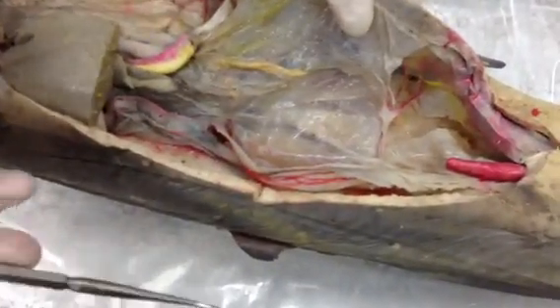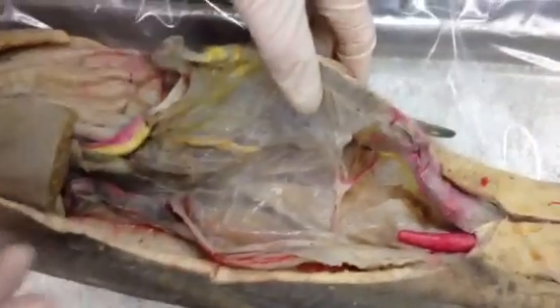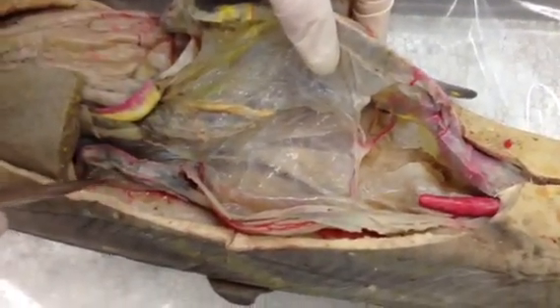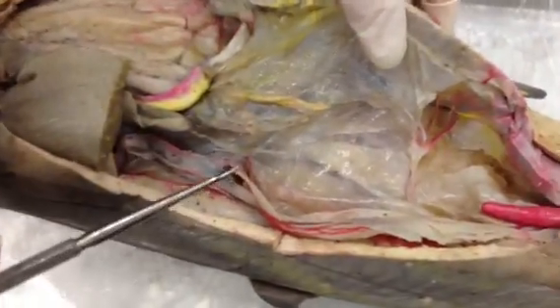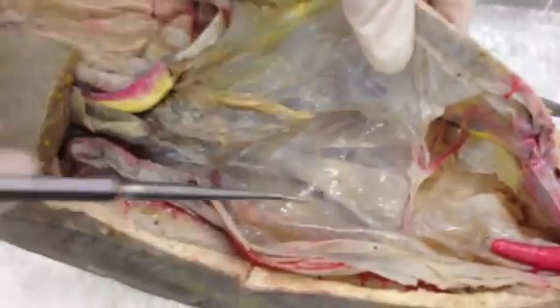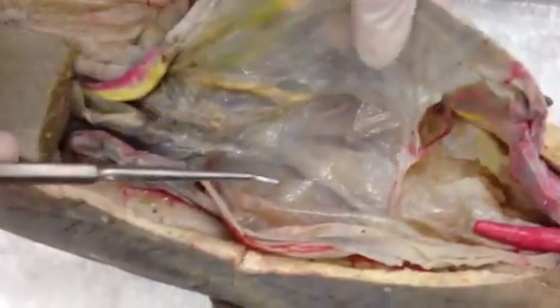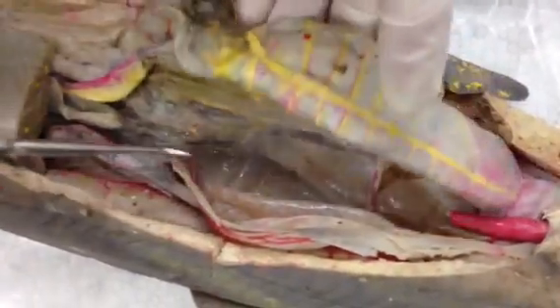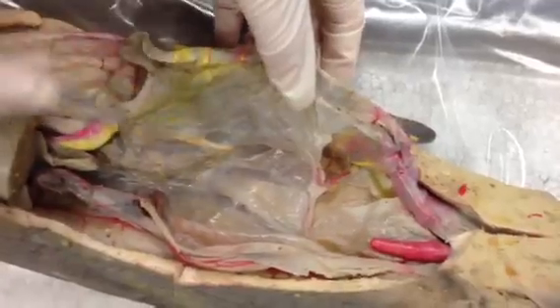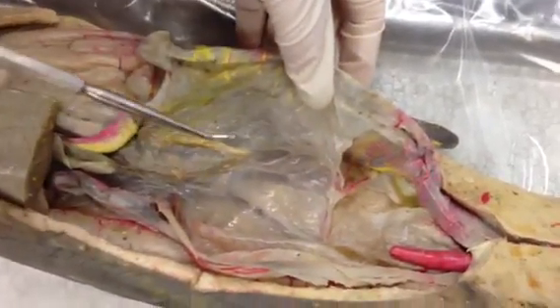For the mesenteries of the shark, the largest one is the dorsal mesentery, and it's all the mesenteries that connect to the dorsal wall. Underneath the dorsal mesentery, there are different categories or names for each individual mesentery. This mesentery that you see here, connecting to the cranial part of the intestine, is just called the mesentery.